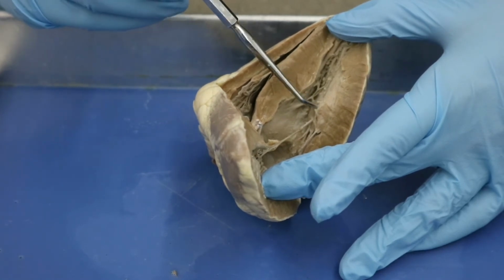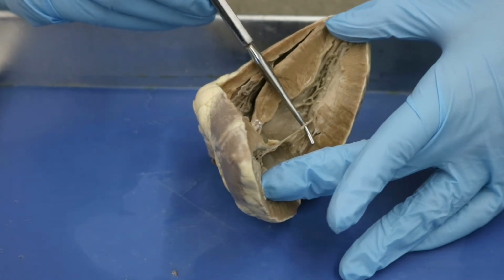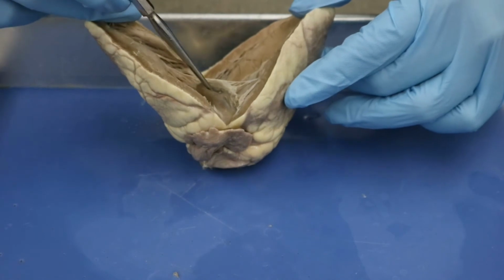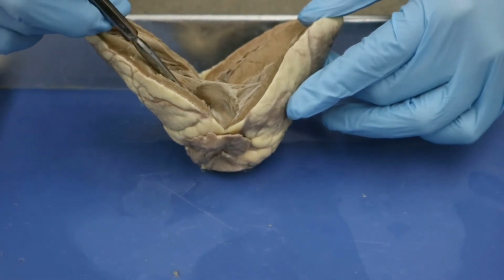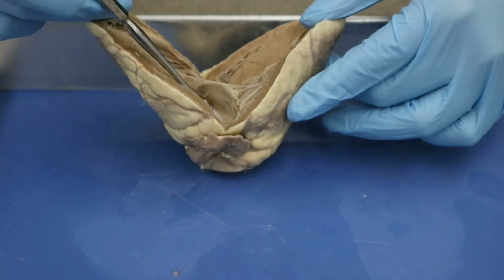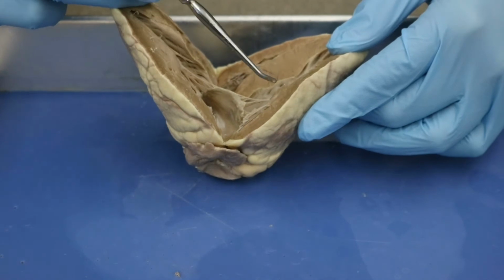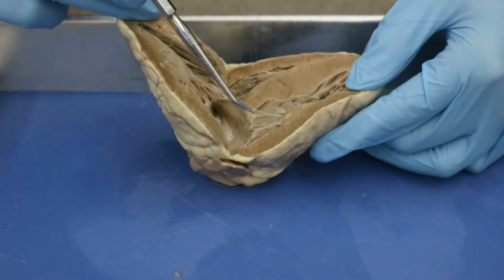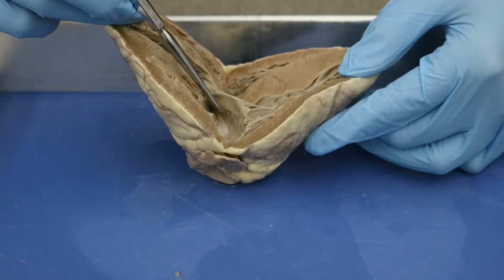Okay, remember your papillary muscle is going to contract, and when it does so, it pulls up on the chordae tendineae, and that deals with this fleshy tissue here. So what would this fleshy tissue be? A valve, right? But this valve is associated with, we can see here, the thicker walled left ventricle. So this is going to be your mitral valve, okay?